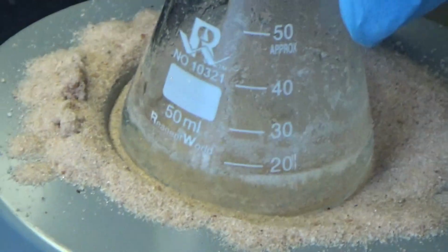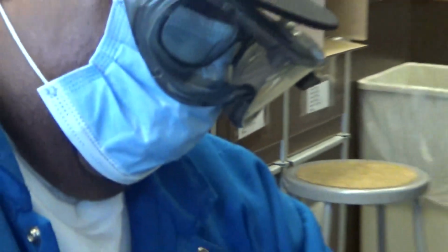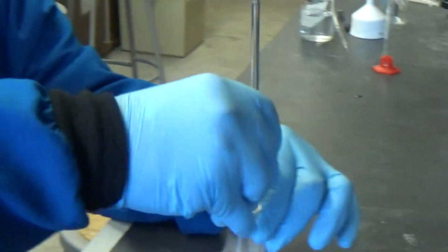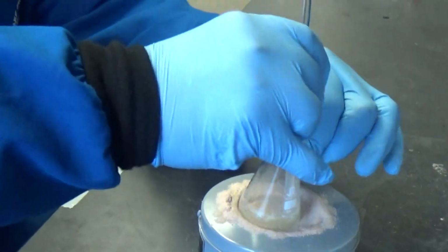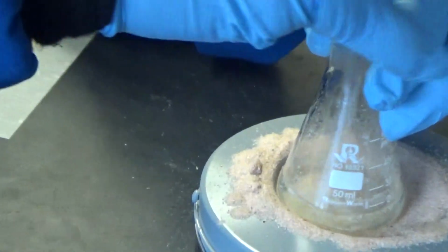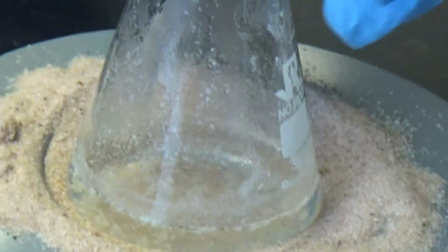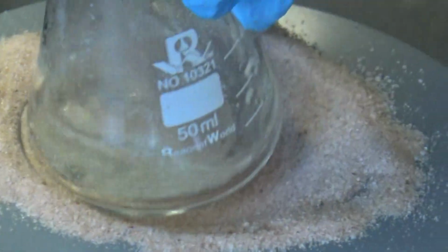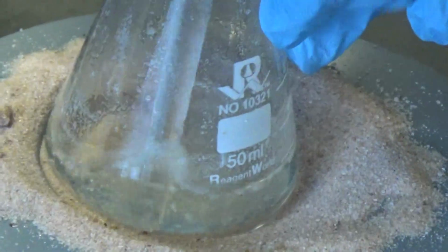Sometimes you may have some impurities which are not going to be soluble at all, and in this case we do what is called a decantation. So it could be a mixture of multiple compounds. If your impurity is insoluble, then you can pour out the good stuff and leave behind the bad stuff. That's probably what's going to happen here. It's mostly dissolved. There's a little bit of junk in there. Just 1 minute more.